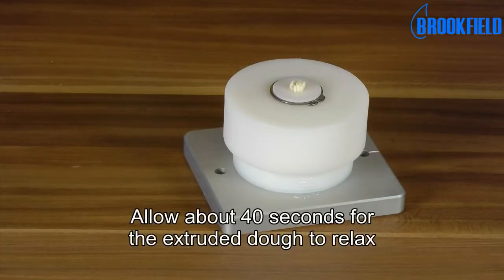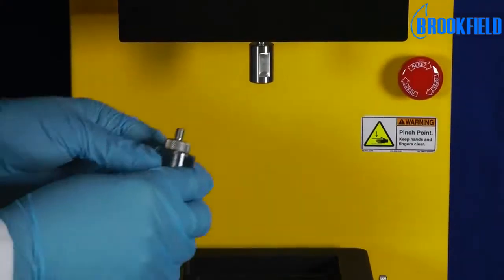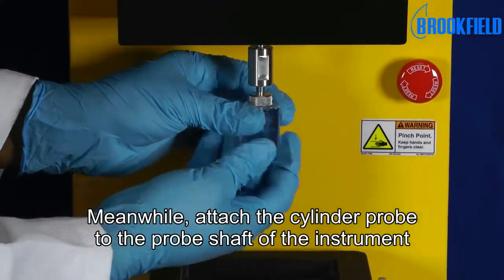Allow about 40 seconds for the extruded dough to relax. Meanwhile, attach the cylinder probe to the probe shaft of the instrument.